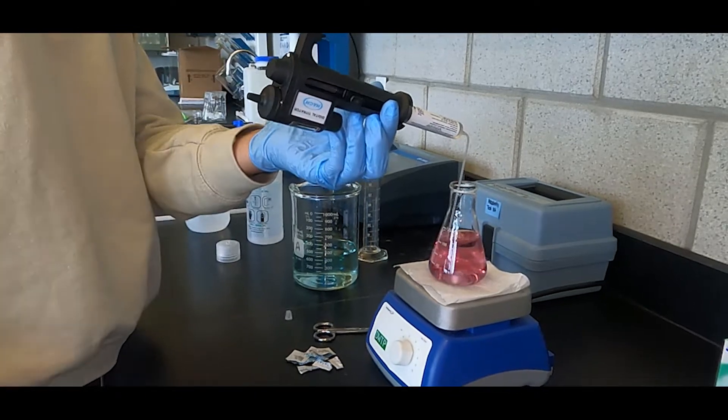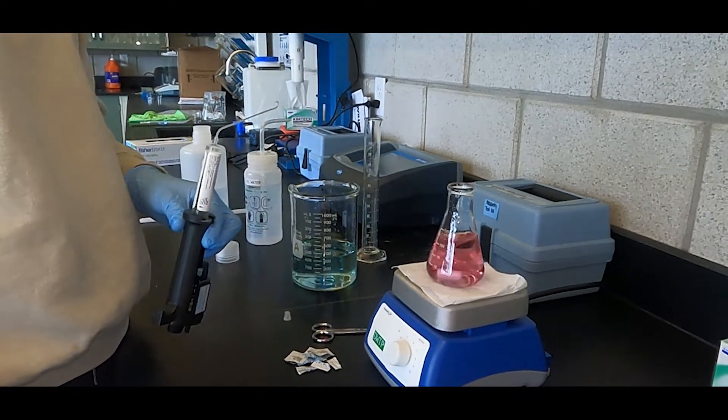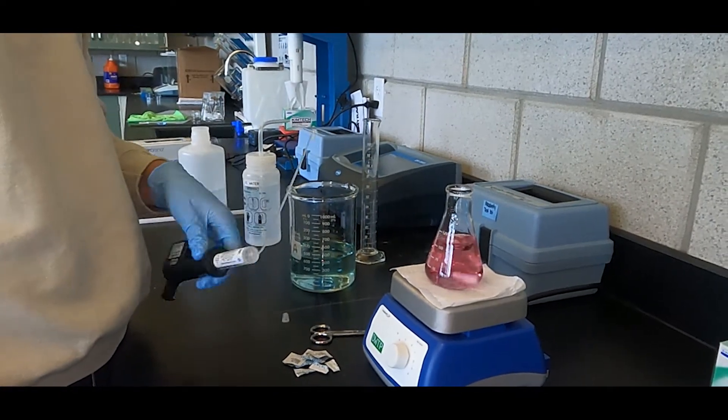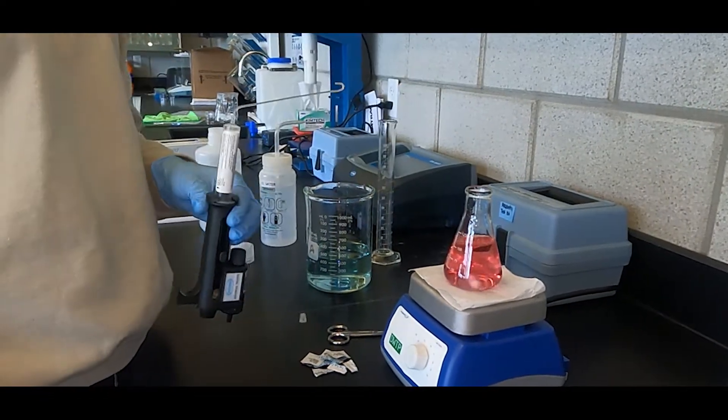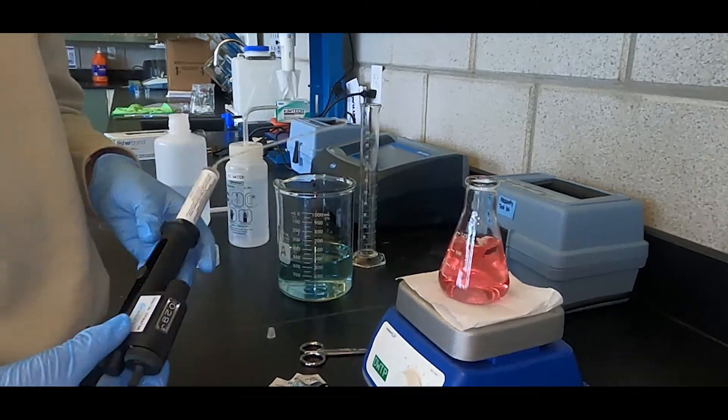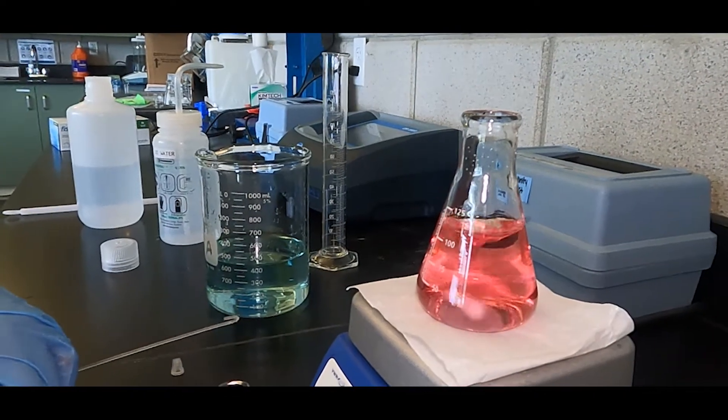If you are unsure that you have reached the true endpoint, mark down the value that is on the digital titrator and then go further. You can always revert back to your last recorded reading if you go too far past the endpoint.